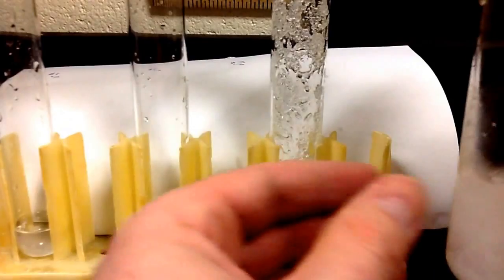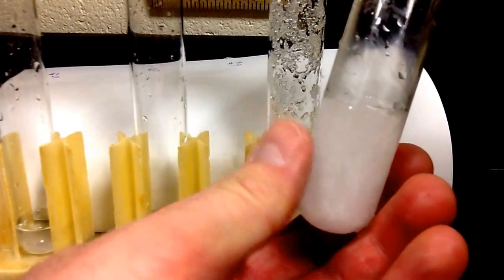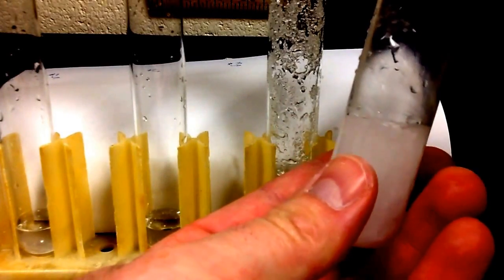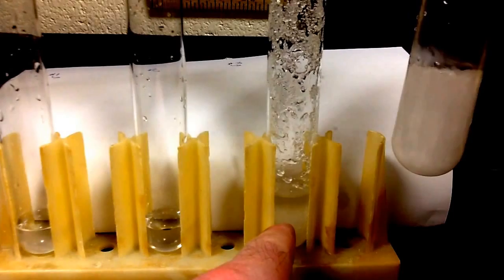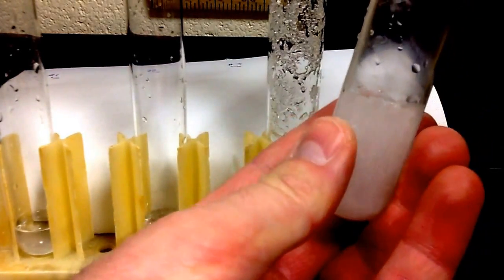Something that's interesting about this is that as we feel it, the test tube is getting very hot. You're going to have to trust me on this one. It's getting very, very hot. Something I forgot to mention is that it actually got cold when we did this step. So when we added the 14 grams, it got cold, and now it's getting hot.